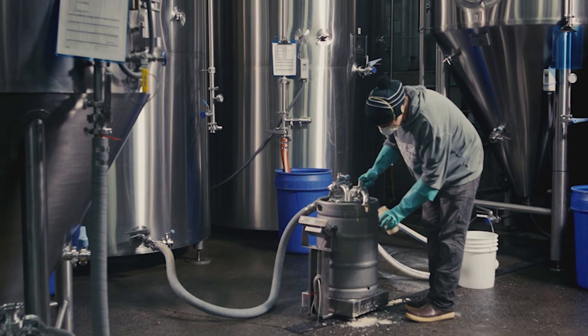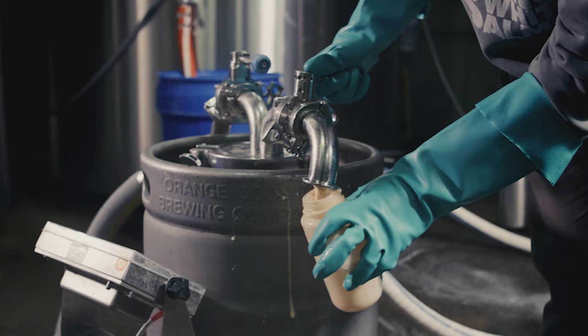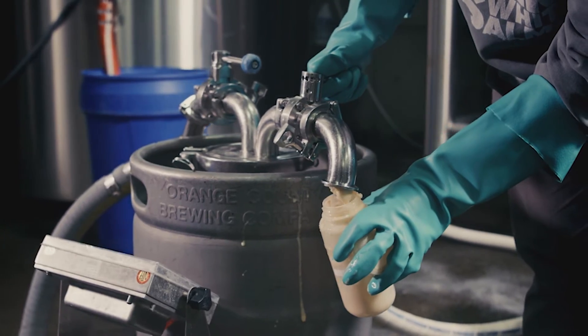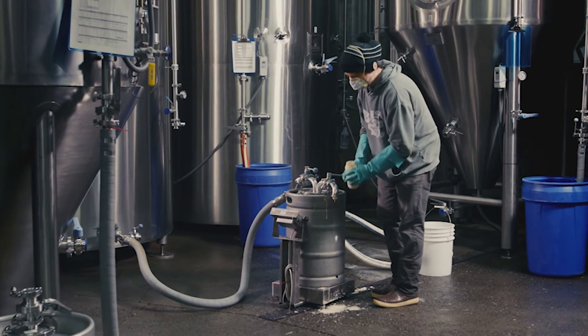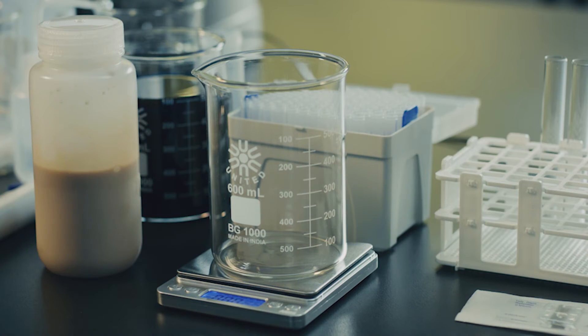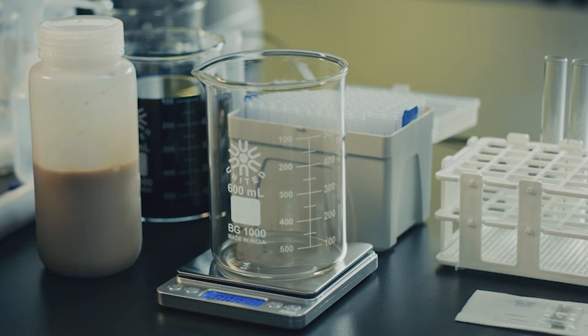Now let's get counting. The first thing you'll do is pull a yeast sample for the count. Be sure to use aseptic technique to harvest the sample from your brink into a container that will allow you to mix the slurry. Use a clean container with a screw-on cap, filling it about half full. You only need about 200 to 300 grams or milliliters.